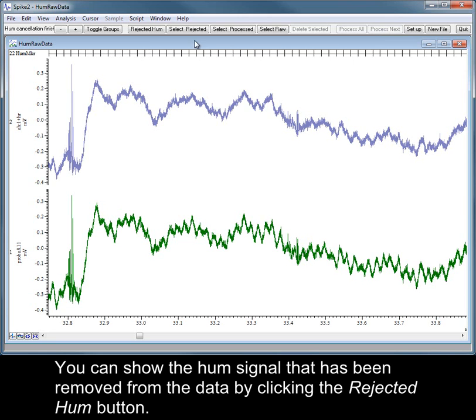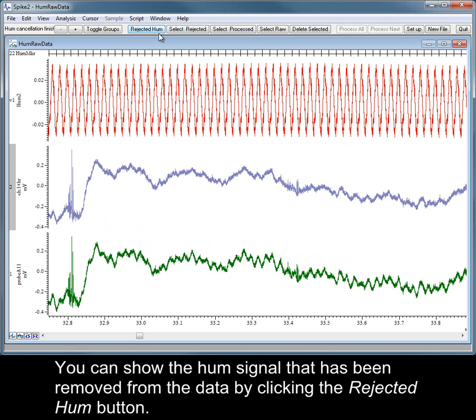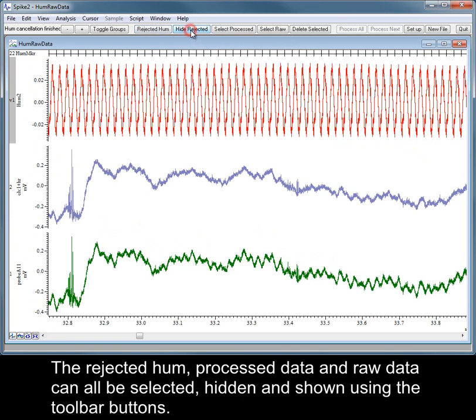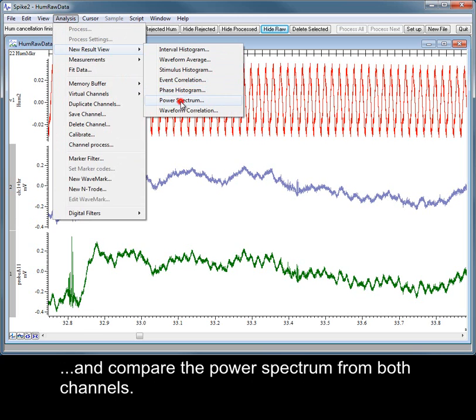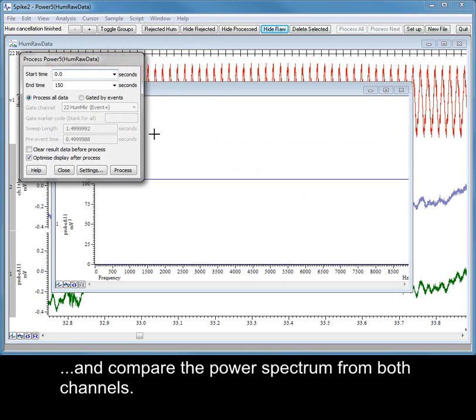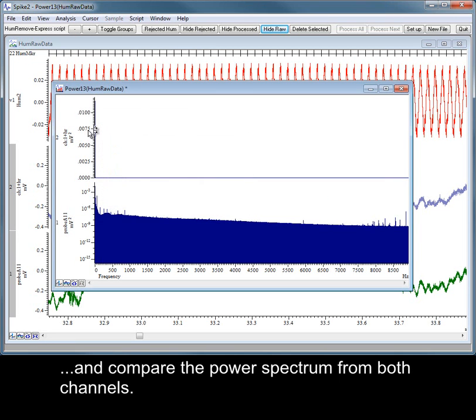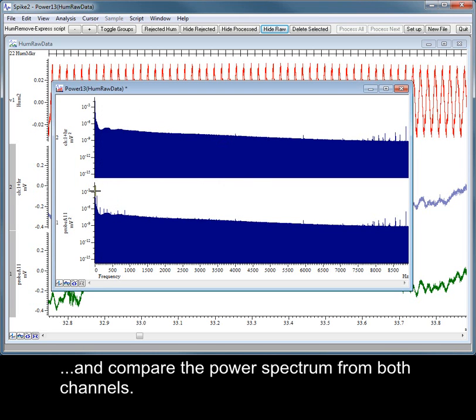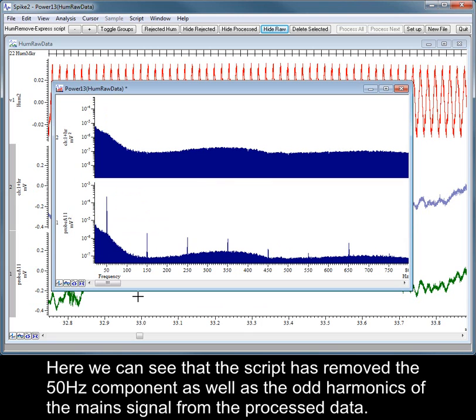You can show the hum signal that has been removed from the data by clicking the Rejected Hum button. The rejected hum, processed data, and raw data can all be selected, hidden, and shown using the toolbar buttons. We can select both the raw and clean version of the data by holding Ctrl and clicking on the channel numbers, and compare the power spectrum from both channels. Here we can see that the script has removed the 50 Hz component, as well as the odd harmonics of the mains signal, from the processed data.